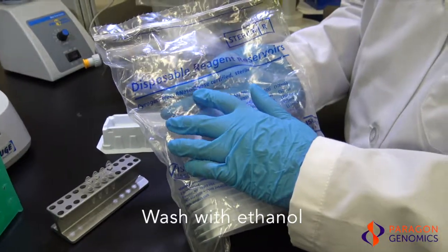Wash the samples with 70% ethanol. You can use a nuclease-free trough to dispense 180 µL of 70% ethanol to multiple samples. Do not reuse the ethanol in the trough.